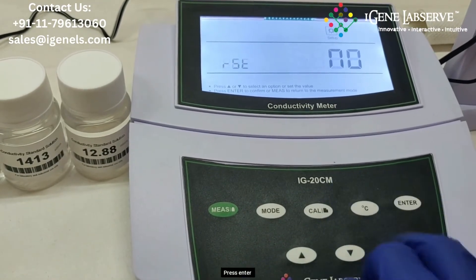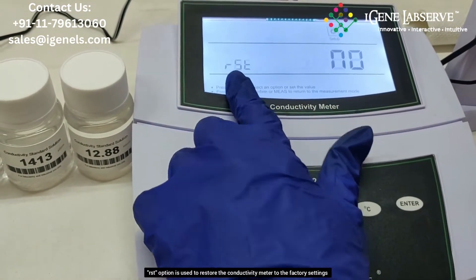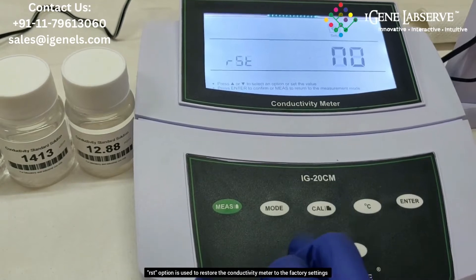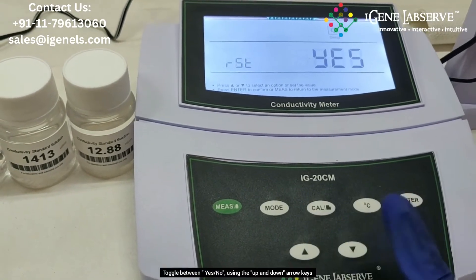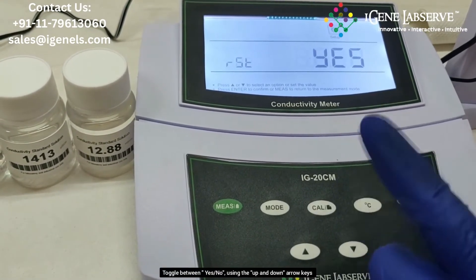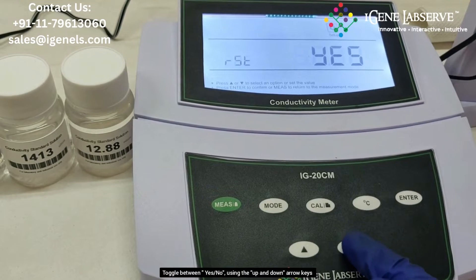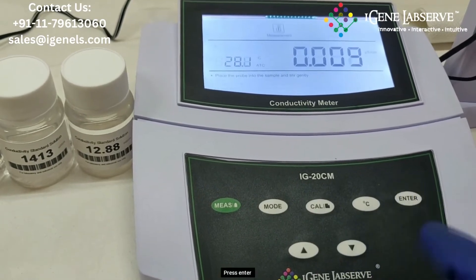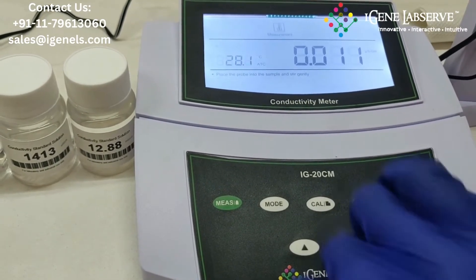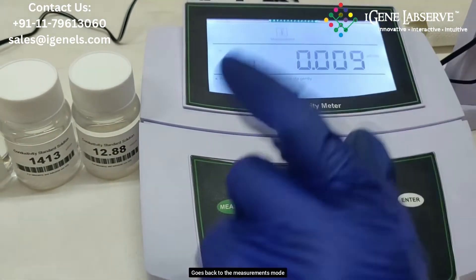Press enter — it goes to reset. You can select yes if you want to take the machine to factory reset settings. Press enter and it comes back to the measurement mode.